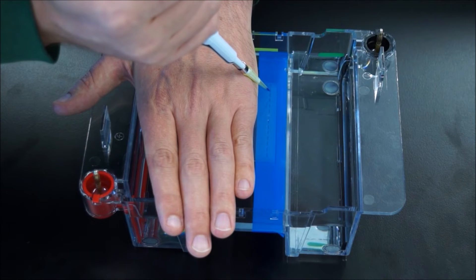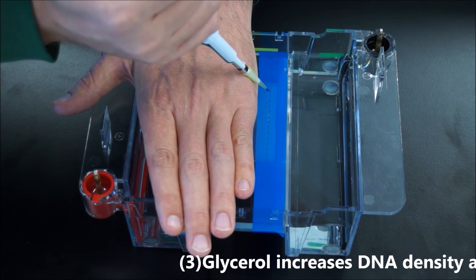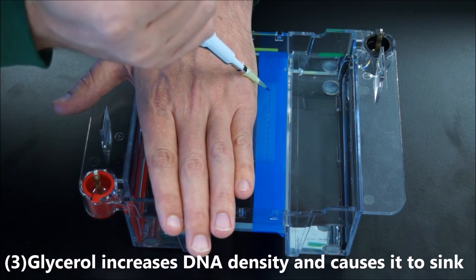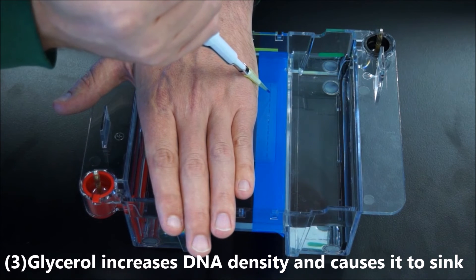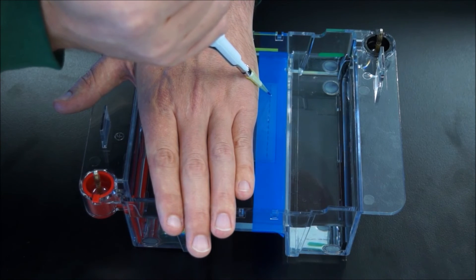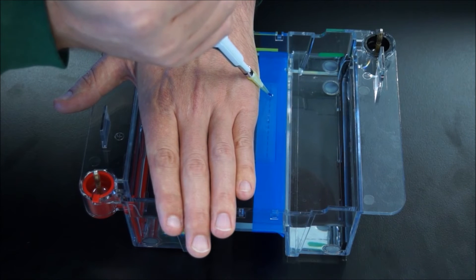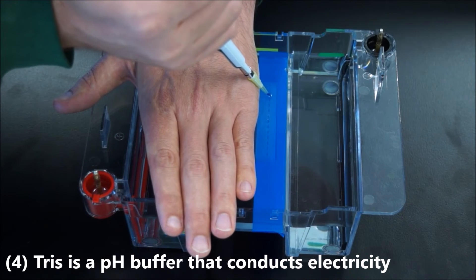You want to go into the well. You want the liquid to go into the well. You don't want your pipette tip to stab through the bottom though. To do that, you can stick the pipette in and you can tell that you're inside the well by giving it a little wiggle.